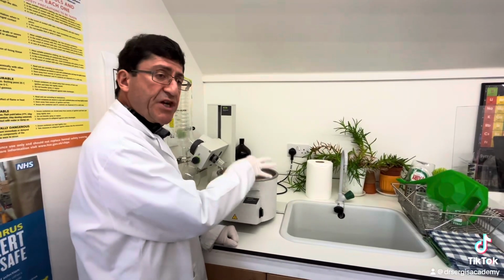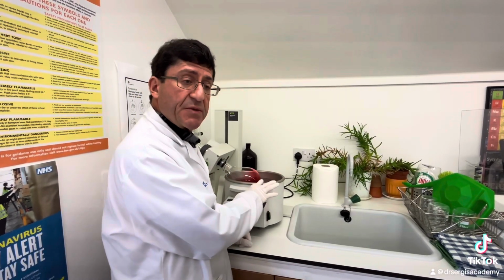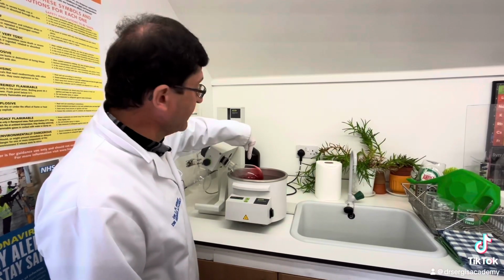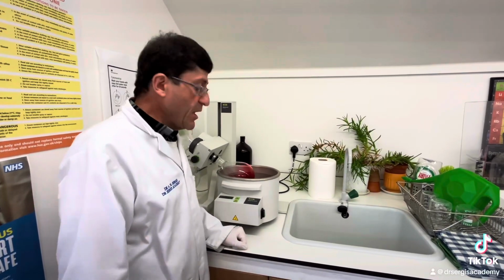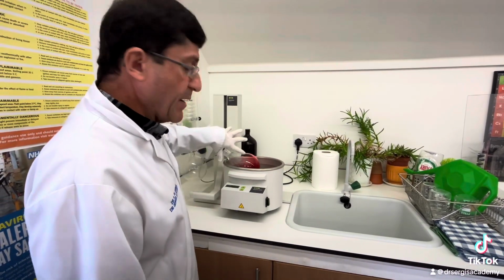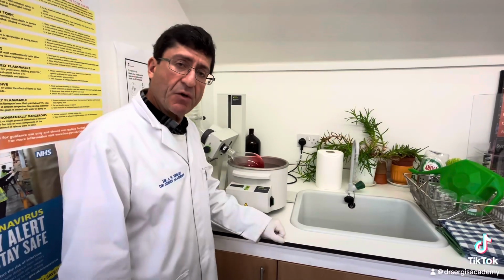So when the water reaches 70 degrees, on its way to reaching 100 degrees before it boils, it will cause the solvent inside this round bottom flask to boil, because let's say it boils at 70 degrees. When it boils off, you've got the phenomenon known as evaporation. So it evaporates at 70 degrees Celsius and the liquid evaporates into a vapor or a gas.